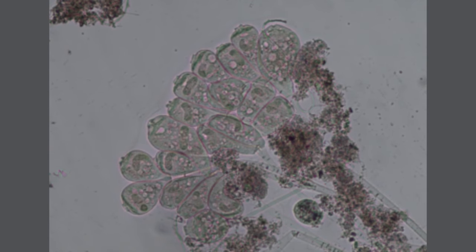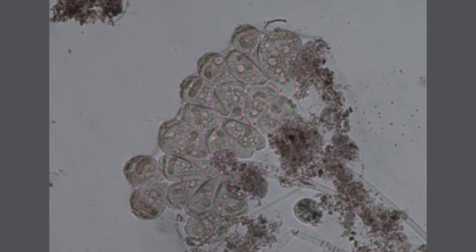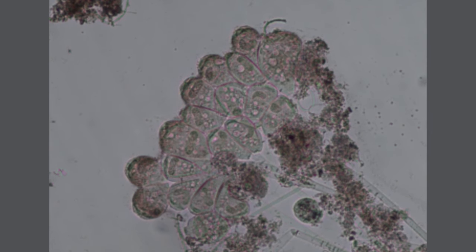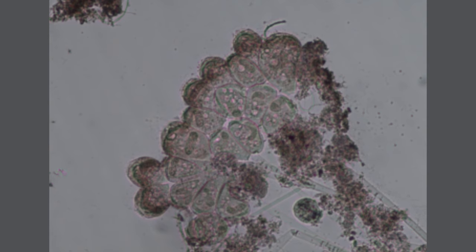The ciliates quickly stop feeding and shrink back in response. Persistent exposure will lead to death.